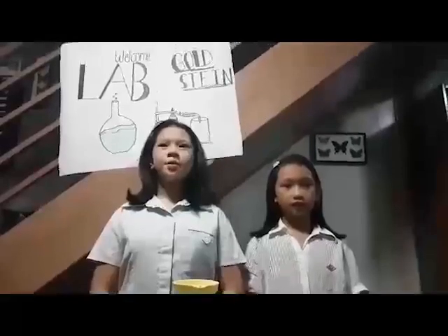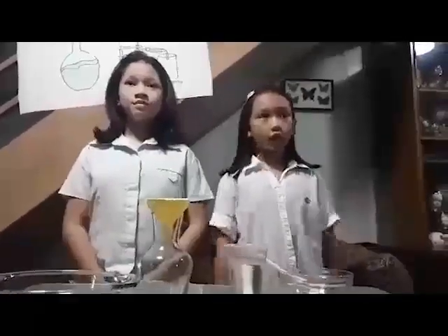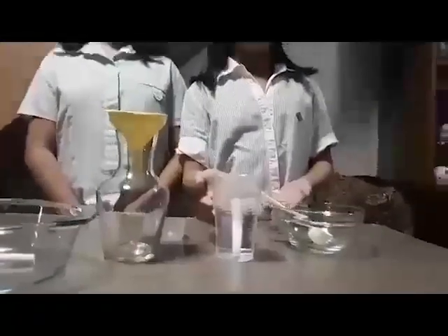We are separating solid-liquid mixtures. Let's start with an example. If accidentally I drop a piece of chalk into a bottle, it is a heterogeneous example. Why? Because in one part we have a chalk piece, and in another part we don't. So it does not have the same composition. How do we separate it?